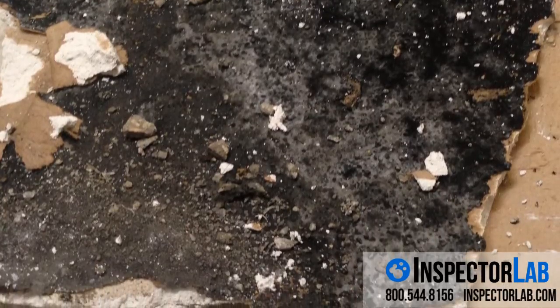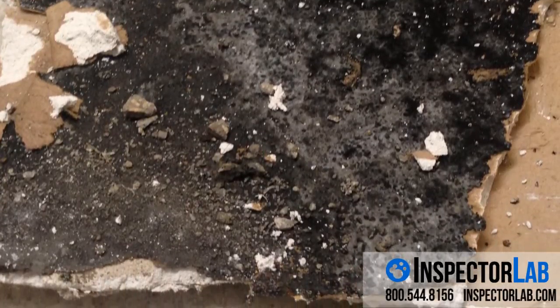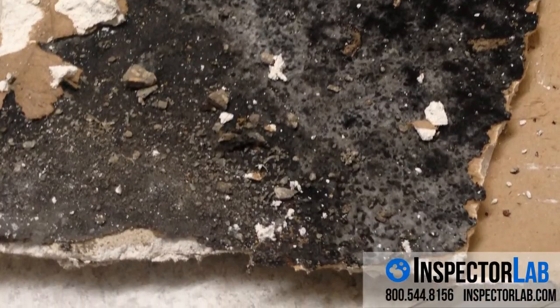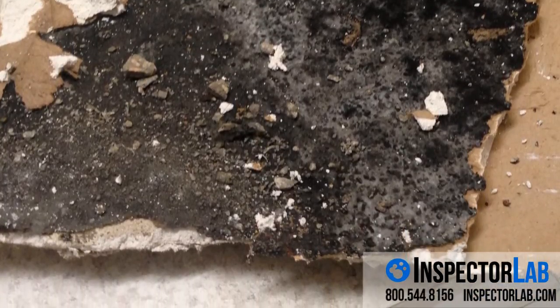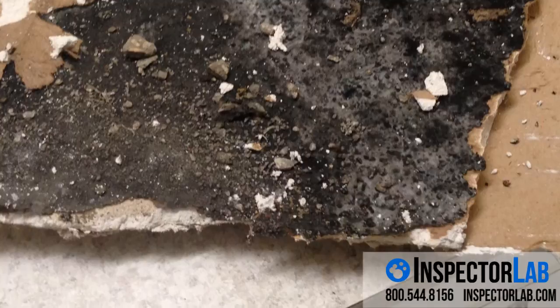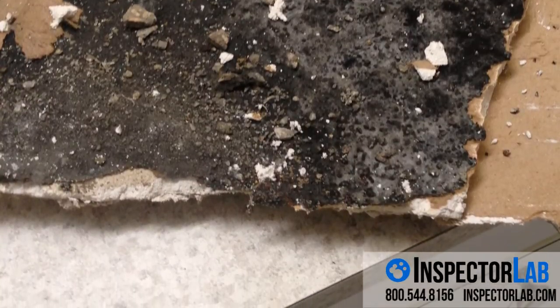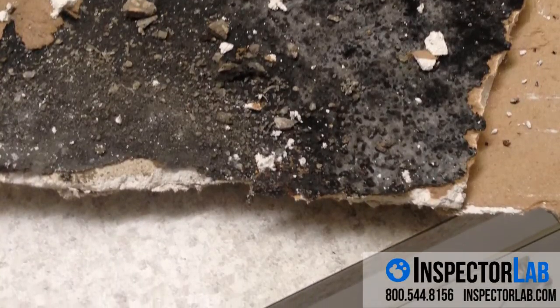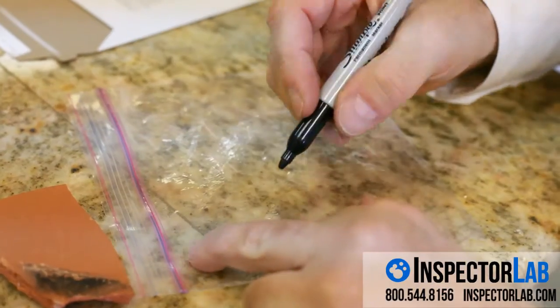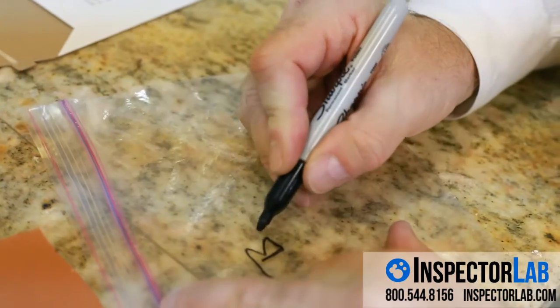To take a bulk sample, make sure your clothes and hands are dust free. Make sure to only touch the bulk sample on the edges. First, locate the area or material to be sampled. Only a small piece of the material or object is needed — the bulk sample should be able to fit into a sandwich-sized Ziploc bag.